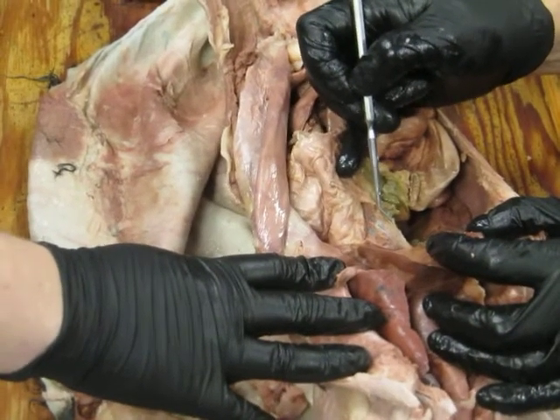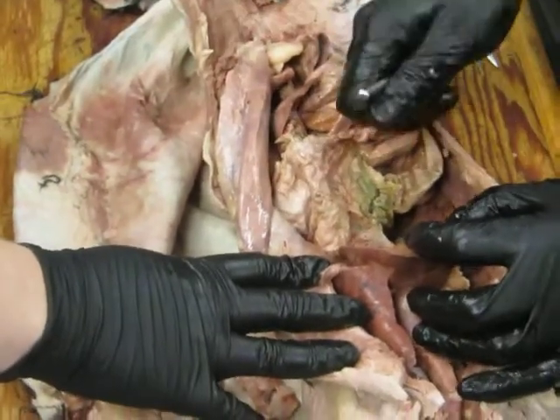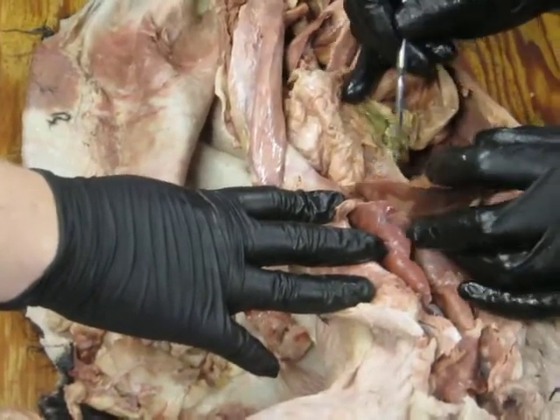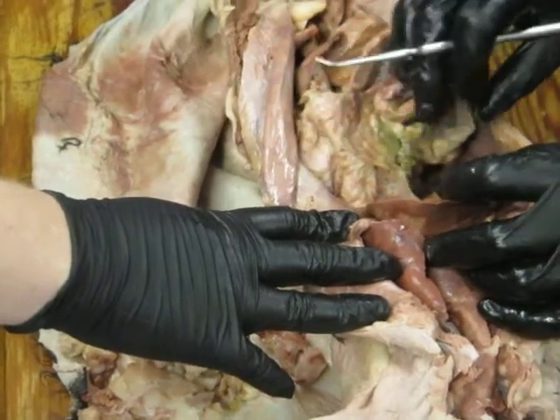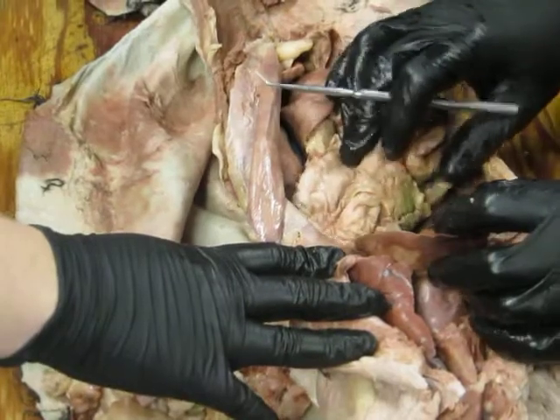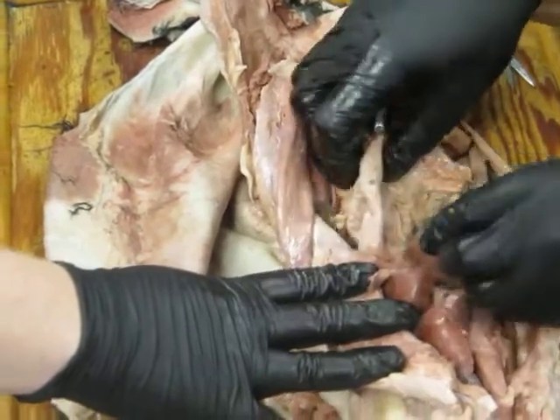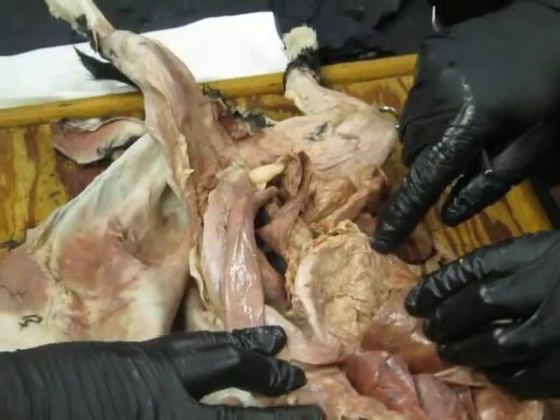So you pretty much can just count on that. You pull the liver away from the gut and look for something strange between them. That's lesser omentum. That's a lesser omentum, and if we dissect down in through that, we could find the bile duct running through there and blood vessels and whatnot. So that's connecting then liver to the gut, and particularly to this first big part of the gut that we see running down in this abdominal cavity, and that's stomach.